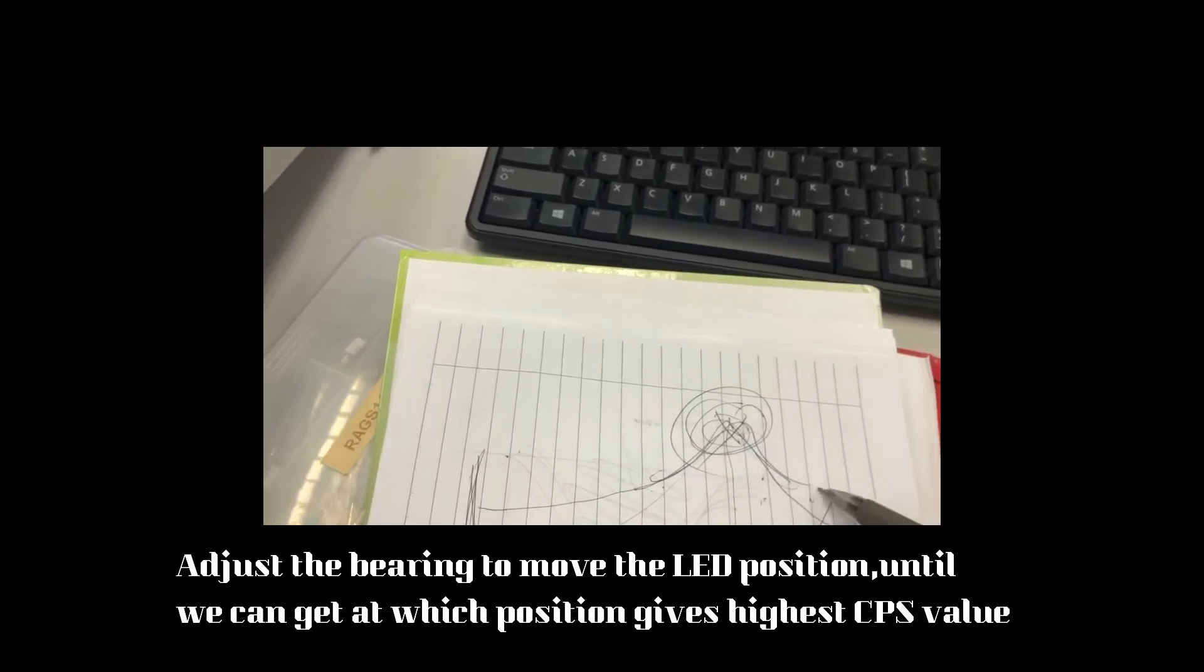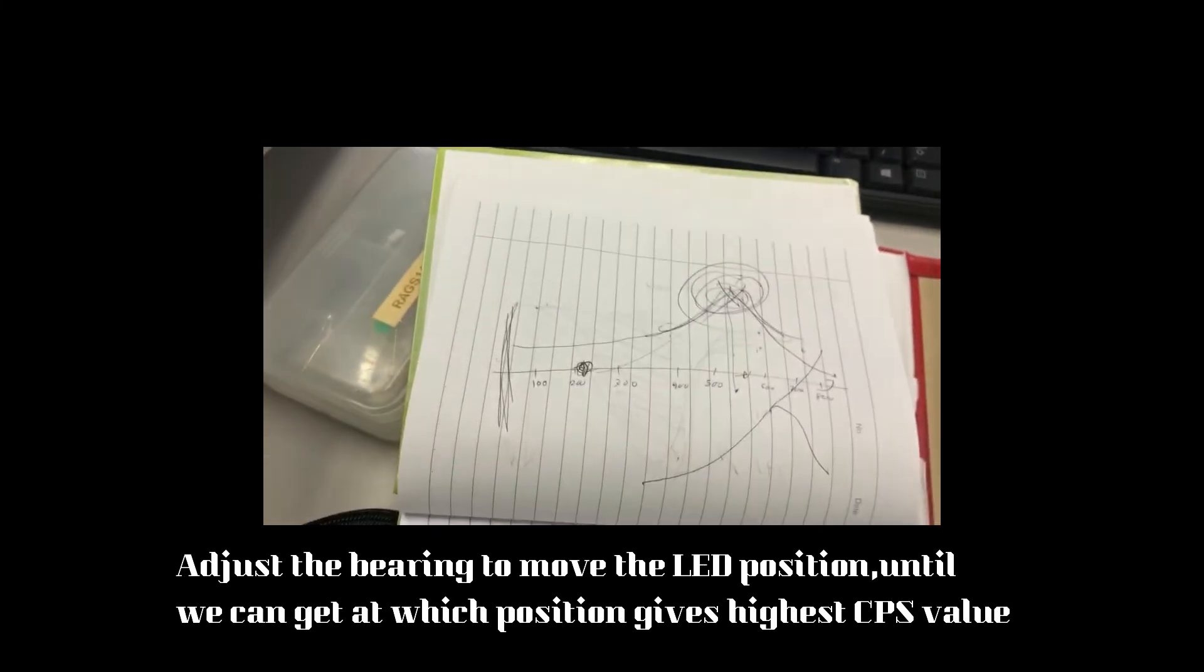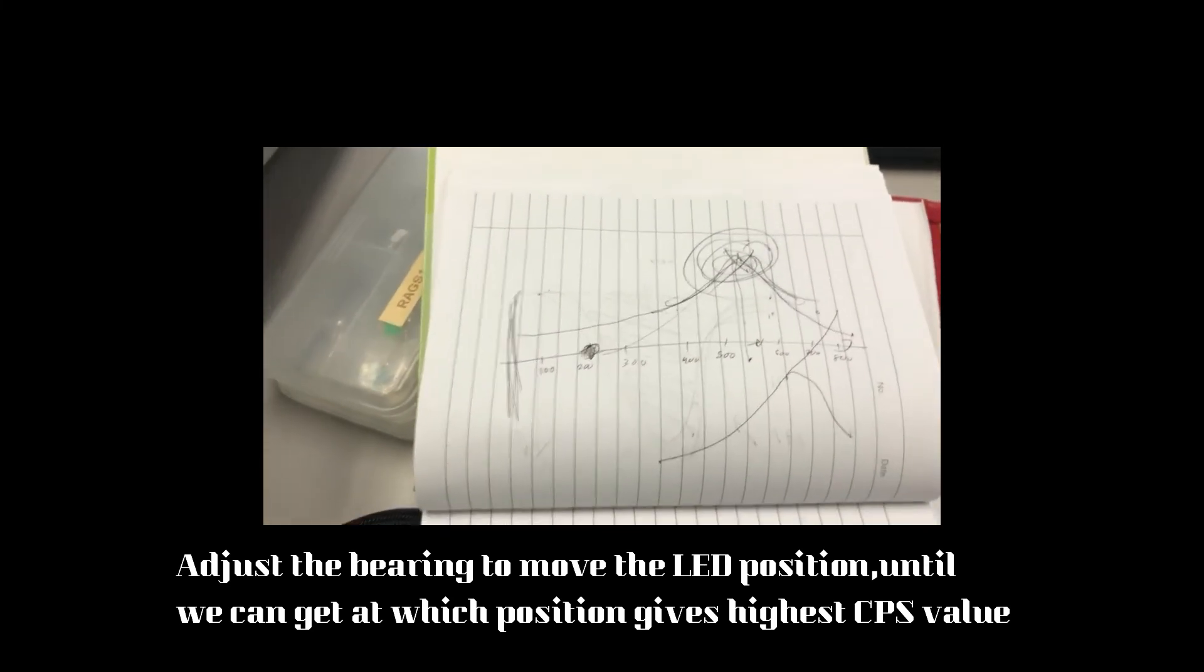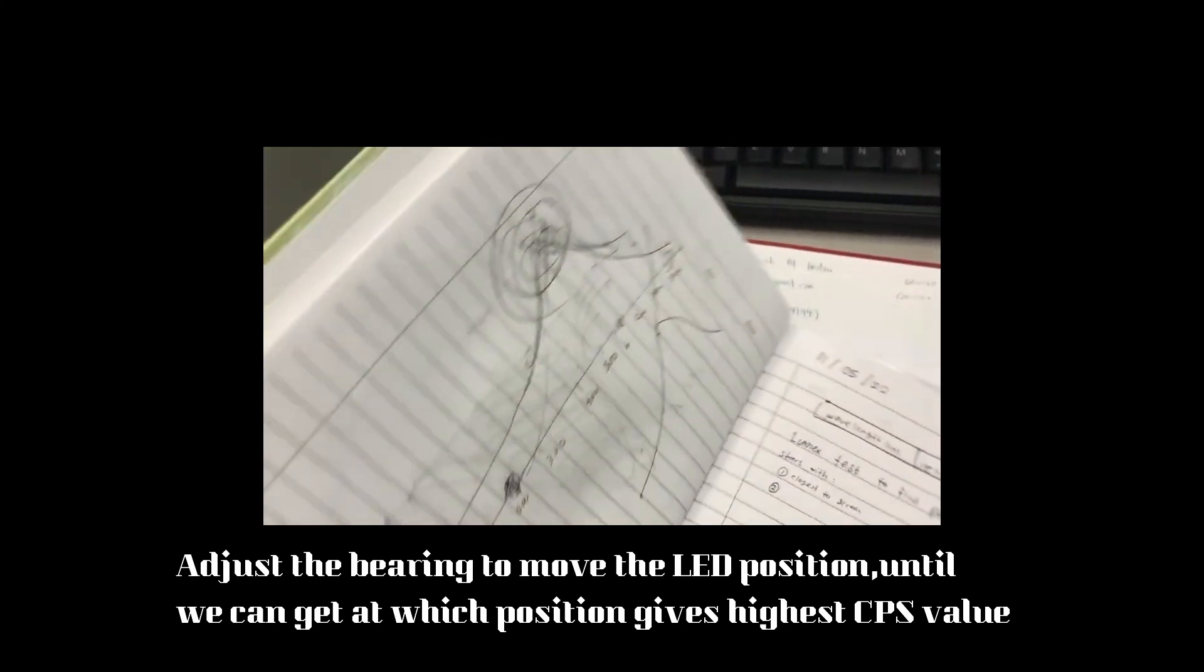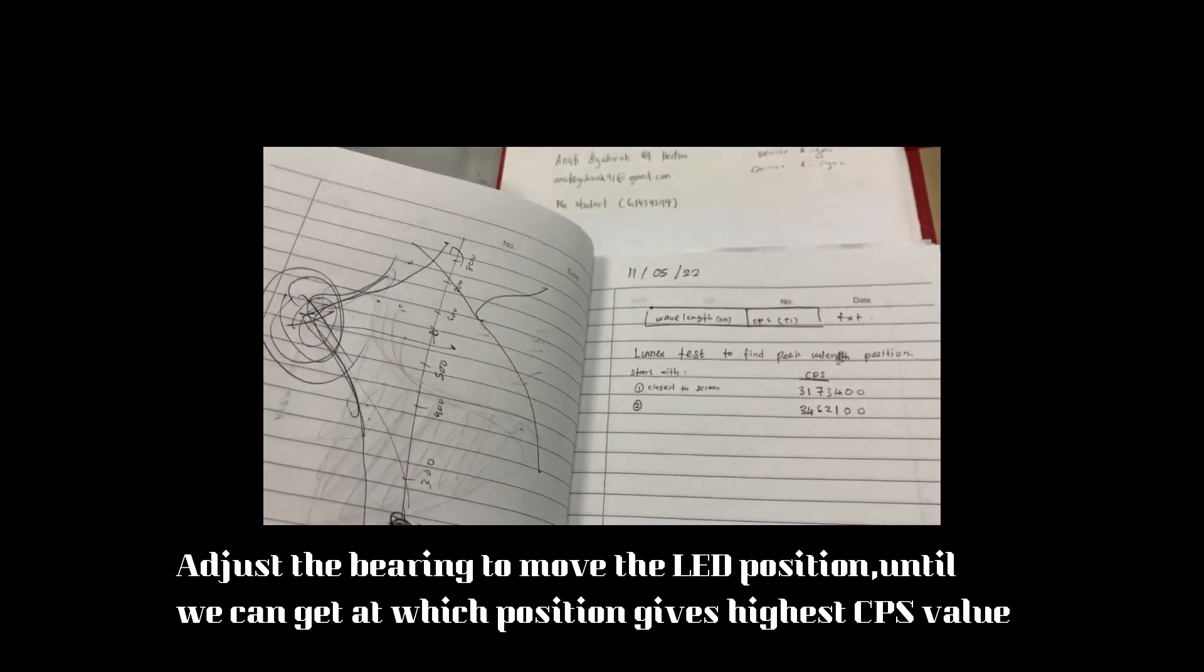We need to find maybe here or here. We need to find it after we have moved it. We need to move it further away. That's how you will find how to adjust the real-time value for the LED.